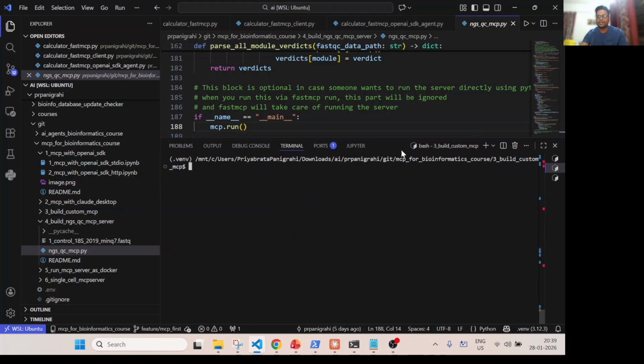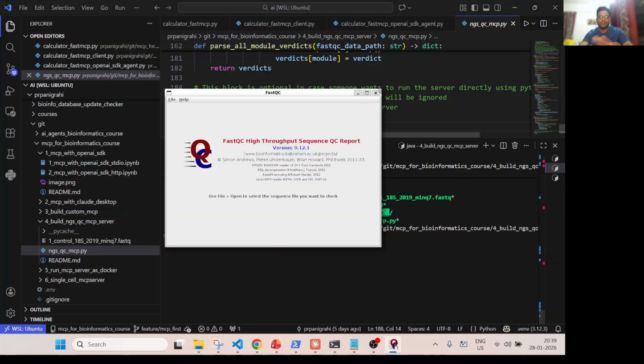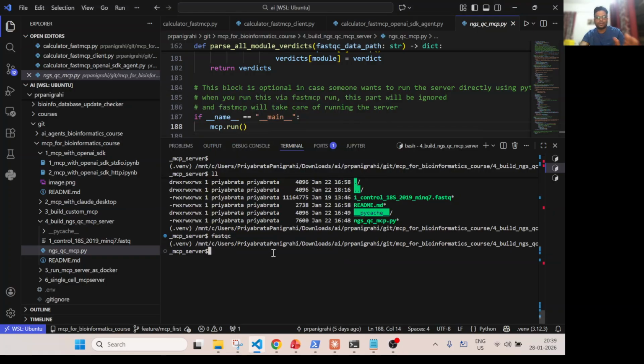So now let's run it. Let me go over to this folder over here. This is the fourth, right? Okay. So now my script is there. And as I said, I have already installed FastQC here. It's there in my system, so it's working well. And I have created this fastq file over here.